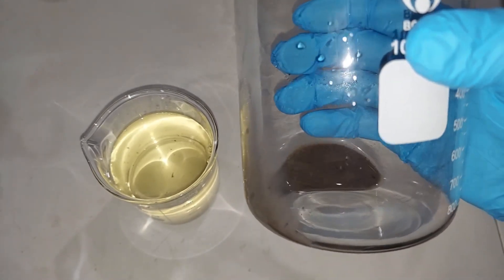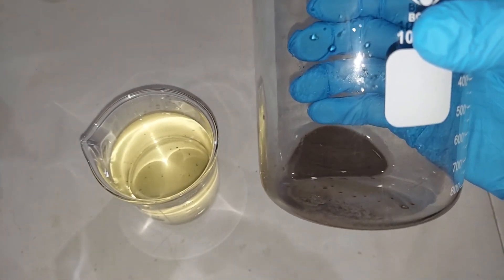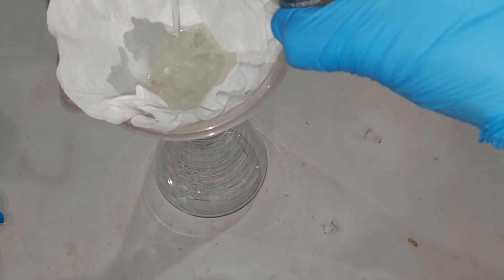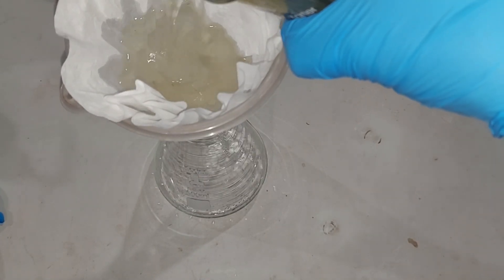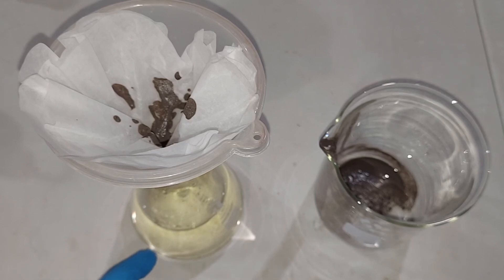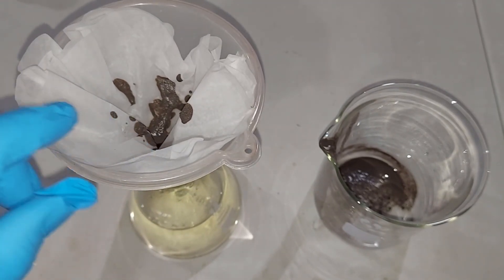Because we used excess carbon, you can see that this is mostly black or very dark. To get the cleanest, purest liquid I can, I've double filter-papered this. I just finished my second filtration, using double sheets of filter paper each time to clean the solution as best I could. I also tried filtering the denser settled material thinking it might have a higher concentration of potassium carbonate, but all it did was make a mess, so we're done with that.